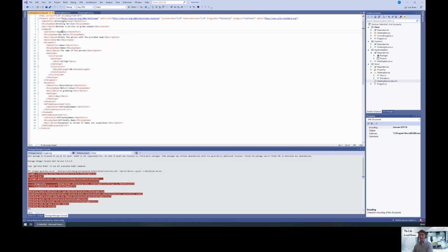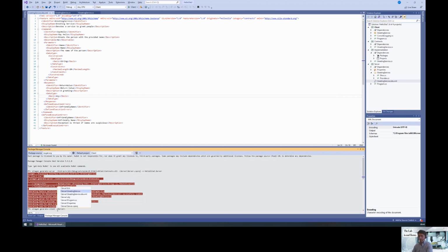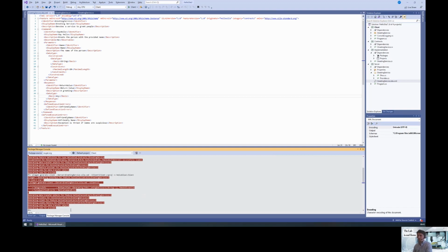We have the generated feature again. So we still have the SayHello command that takes a name, and the result is a response, which is a greeting, and the data type is Any. Okay, so far, so good. So how do we actually work with that? For that, let me also regenerate the client code. So generate client, and then the path to the feature is the generated feature, and the client is the client C# project. I'm also going to forward the namespace.